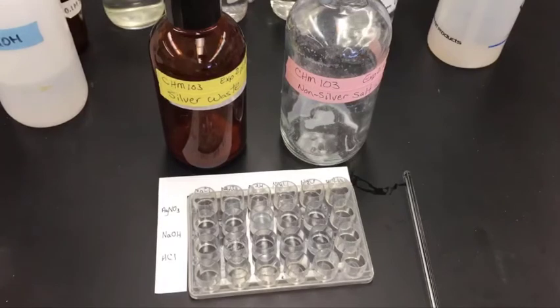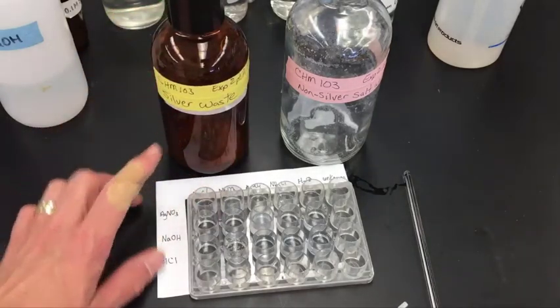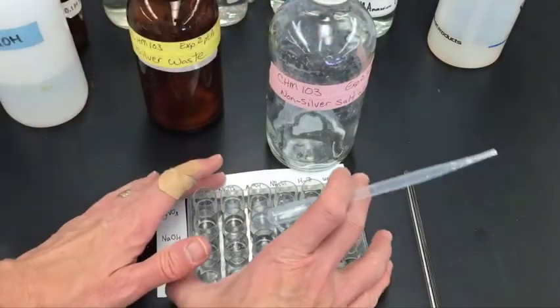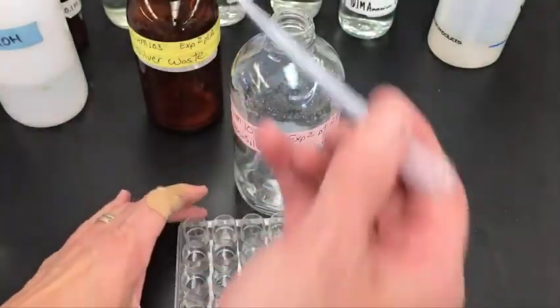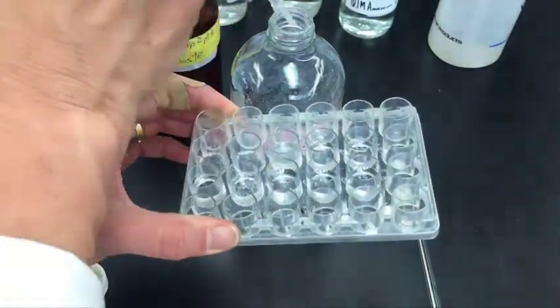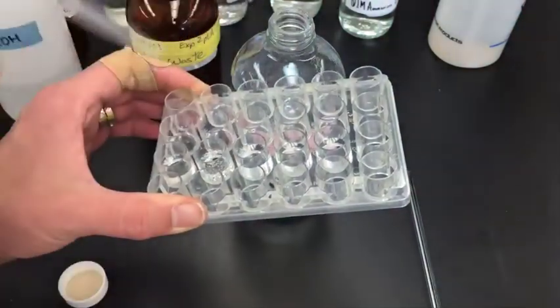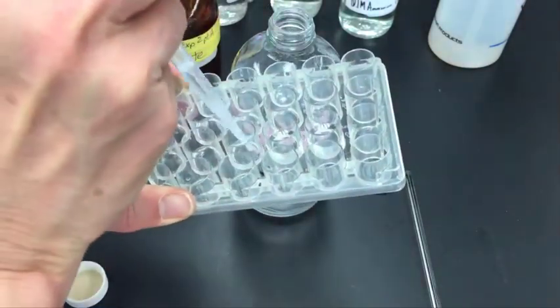When you are done with this experiment, you want to dispose of the waste properly. Anything in the silver row is going to go into our silver waste bottle. The other two rows with sodium hydroxide and hydrochloric acid are going to go into our non-silver waste. I already disposed of the silver waste — I didn't want you to see my results. For the other two rows, we're going to open the container, take a disposable pipette, and suck each solution out of the well and into our waste bottle. That's how we properly dispose of our solutions. The row with sodium hydroxide and the row with hydrochloric acid go into the non-silver salts waste bottle.